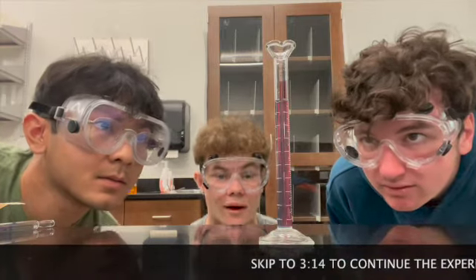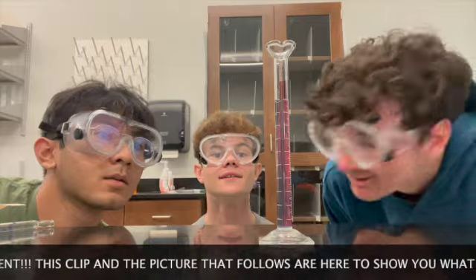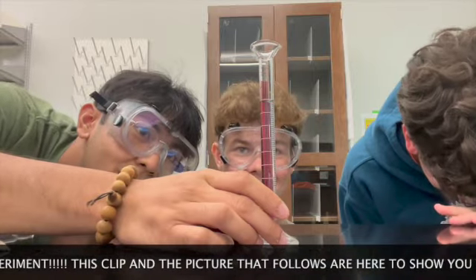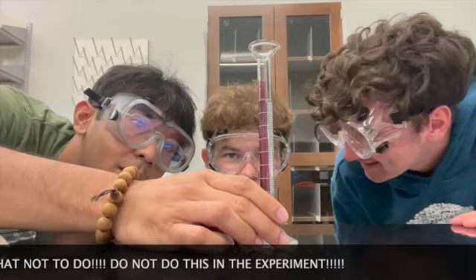So we have about 10 milliliters in here. No, we've got to go below 10. I'll say it's around 9.82. Yeah.